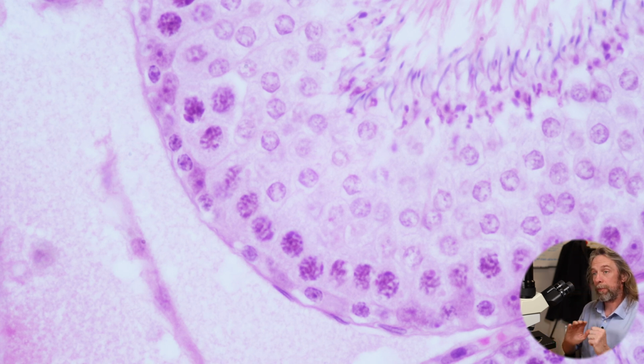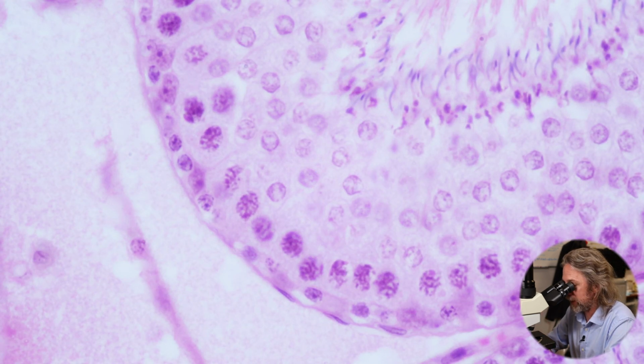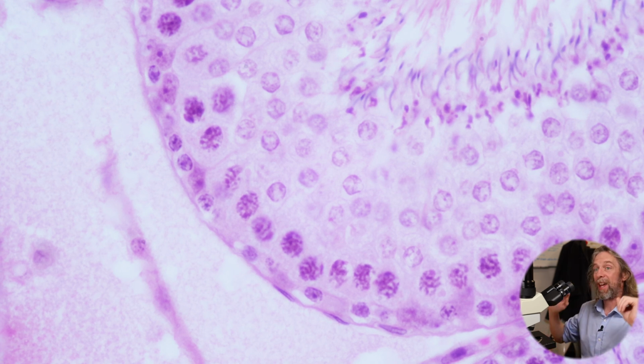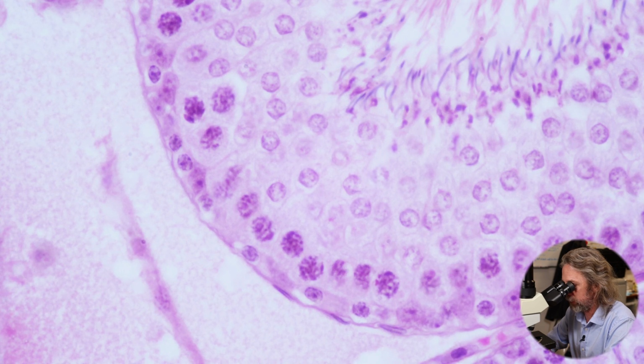Well, when cells of the body go through the cell cycle, when they're getting ready to divide, they duplicate all their DNA. They're still diploid, because that describes them having two sets of chromosomes, but they've copied their DNA ready to divide into two new cells. And that's what we're seeing in the primary spermatocytes there. We are seeing more DNA. That's why they look bigger and darker, because there's more DNA in there, there's more stain. So they've doubled the amount of their DNA ready to enter meiosis, which is the other form of cell division, and the special form of cell division that we're seeing here, which is associated with sexual reproduction.